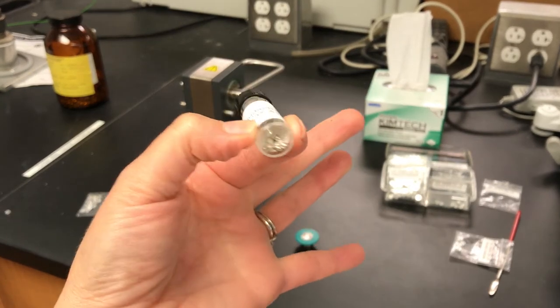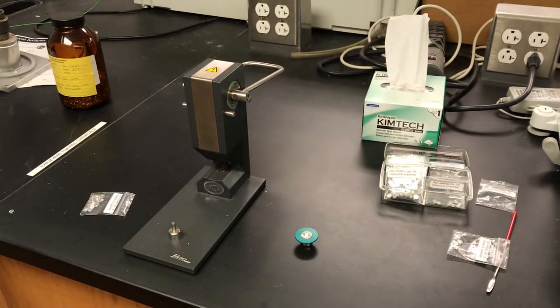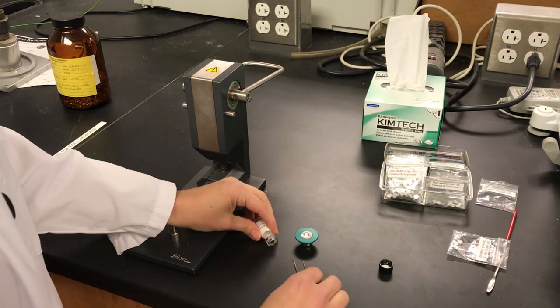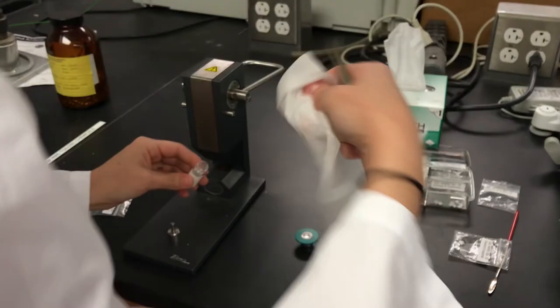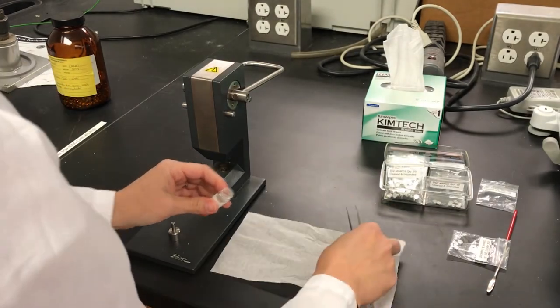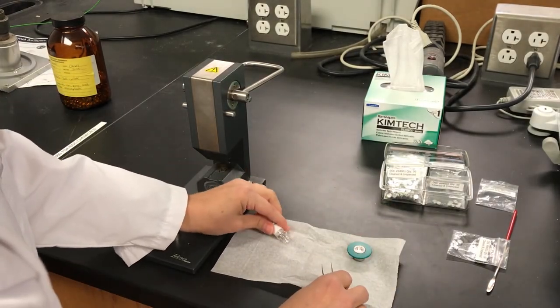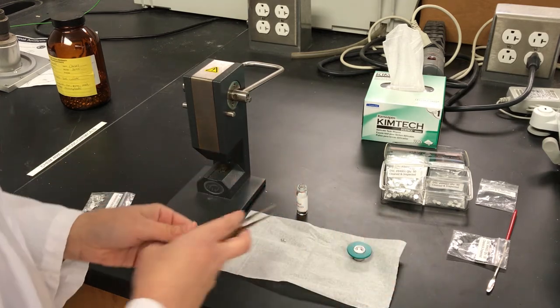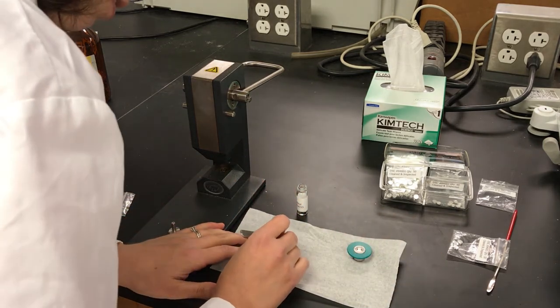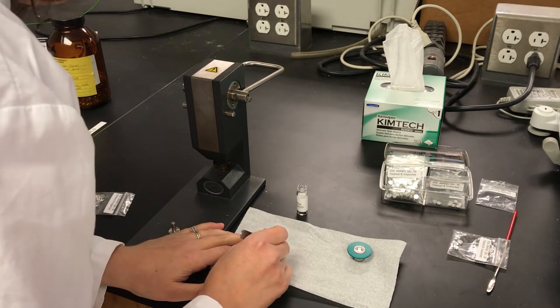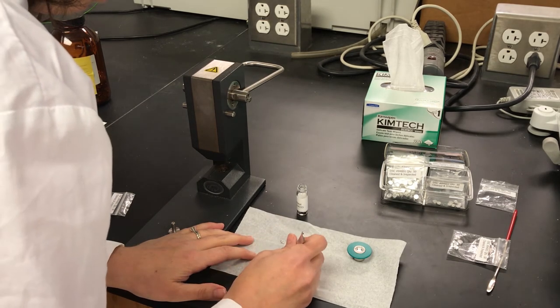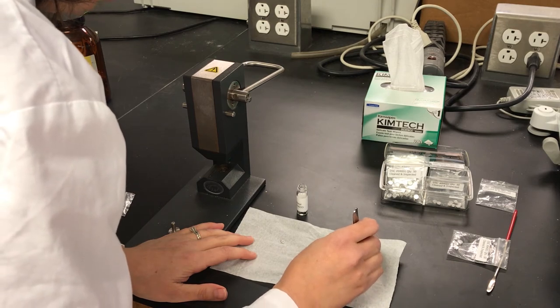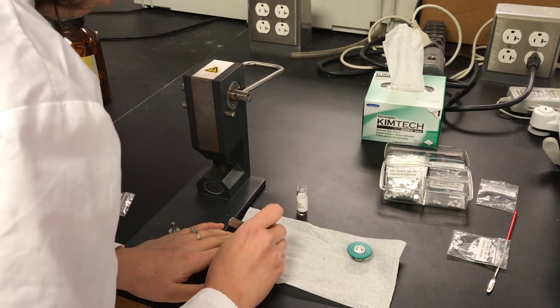These come in these little pellets, which we don't need a whole pellet. So I'm going to try to break it apart using either these forceps or a spatula. Actually, this is a nice one. Yeah, that'll just go right in there as a small piece. But it is easy enough to break this apart.